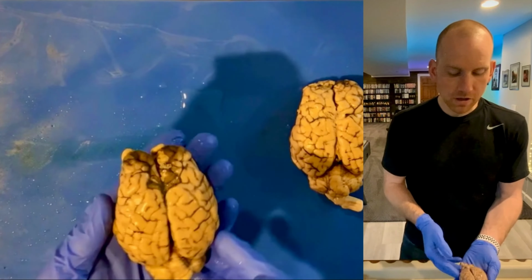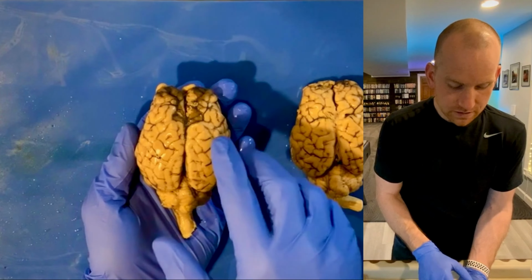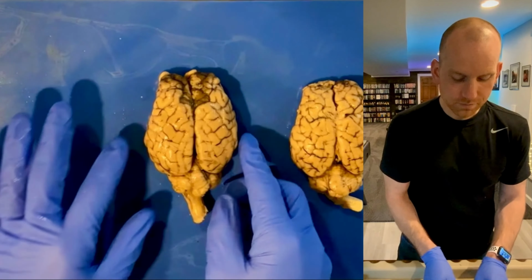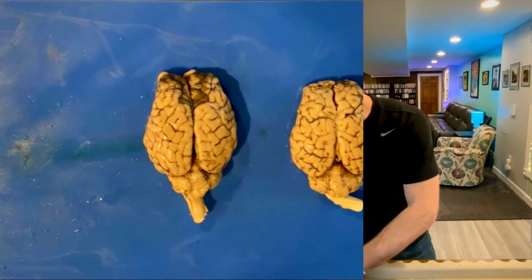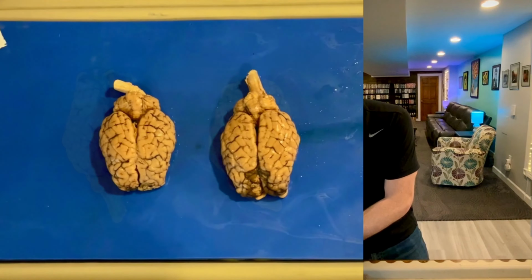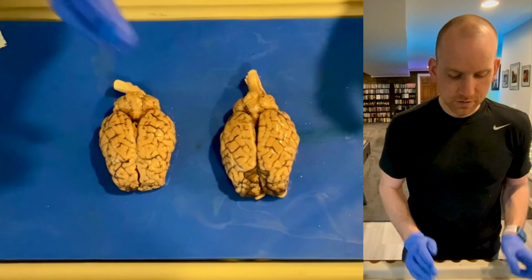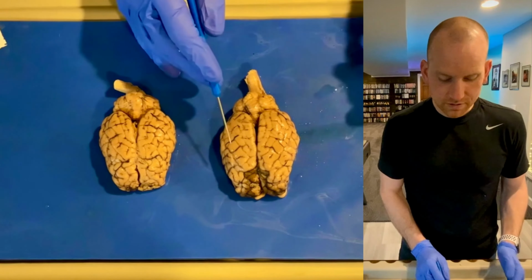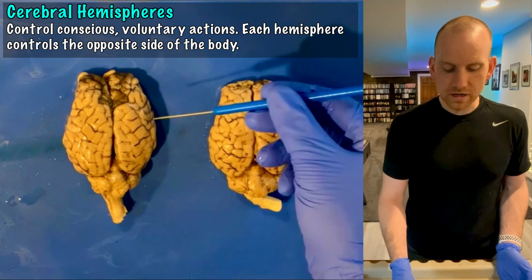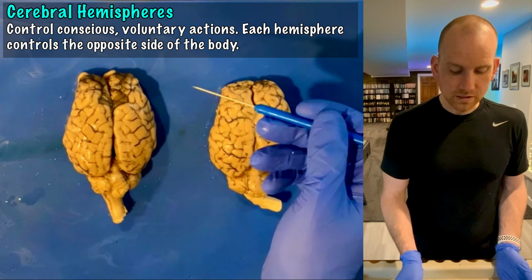So there's a couple other things I want you to see externally here, such as these hills and valleys in the brain. That's super important. So let me grab my probe and we'll point out some of these external characteristics before we cut it open. So looking at the brain, the most obvious thing that you can see are the hemispheres, right? The cerebral hemispheres. Remember, the right hemisphere controls the left side of the body and the left hemisphere controls the right side of the body.